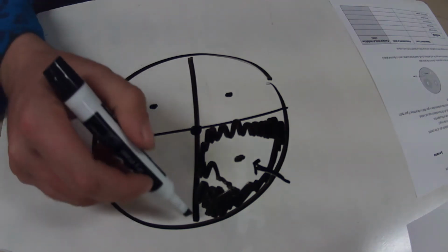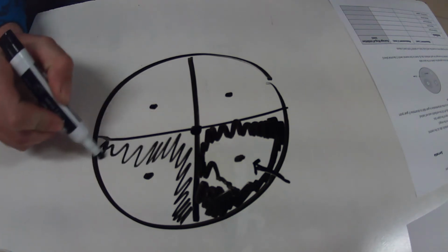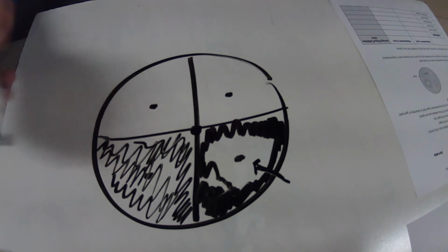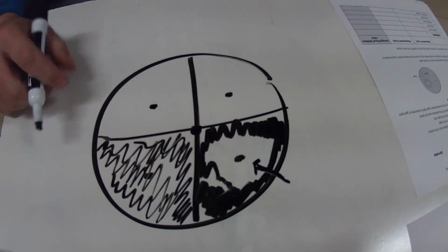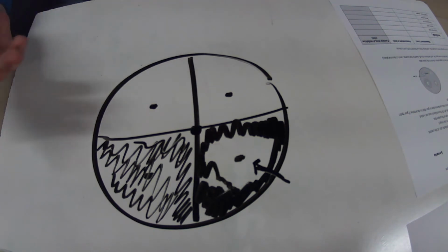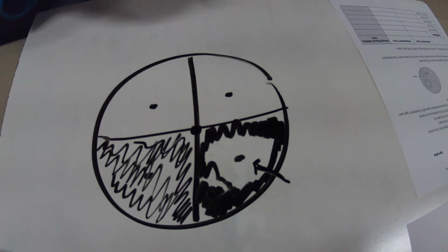Now, in some cases, you might see something like this, where the bacteria grows right over the antibiotic. What this means is that the antibiotic was not effective against that type of bacteria. So the bacteria had freedom to grow. The antibiotic didn't do anything, hence why it goes over the top.